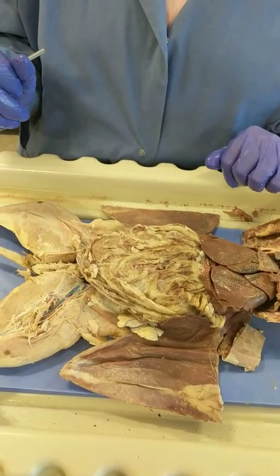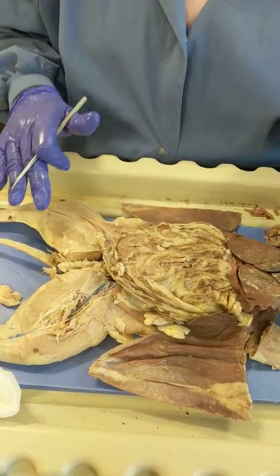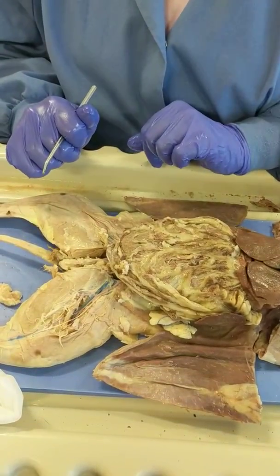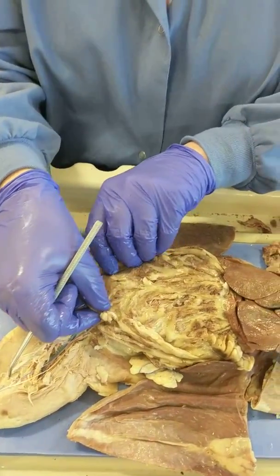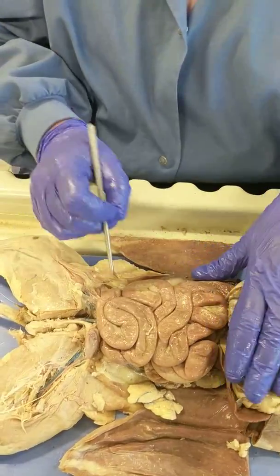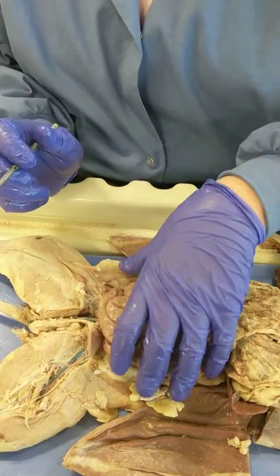Brian and I have dissected a female cat so that we can show you the female reproductive system. First I'm going to lift up the greater omentum that exposes the small intestine.